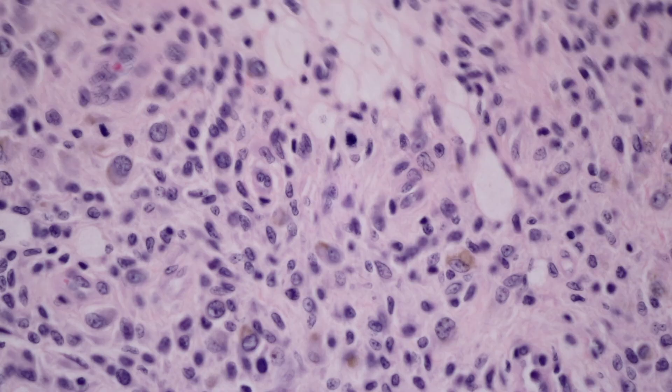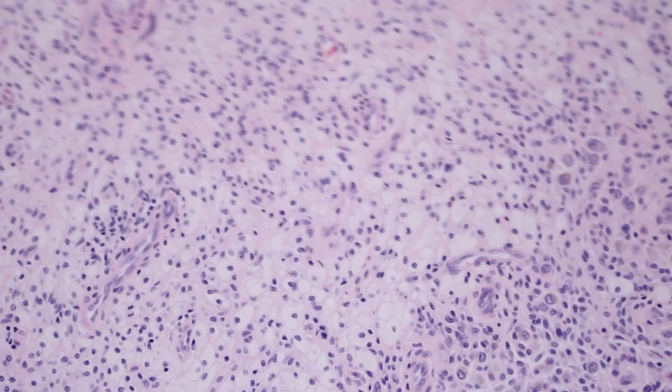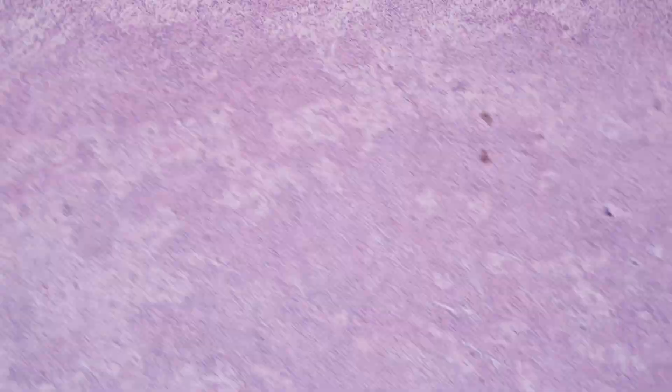In this field you can see mitotic activity — two mitoses just in one field. So the large cells — don't let that worry you. The mitoses — don't let that worry you. The giant cell tumor of tendon sheath form does recur occasionally, but when it recurs, it's local and non-destructive. The diffuse form — pigmented villonodular synovitis — is more problematic. Even though it is technically benign and non-metastasizing, it can be locally aggressive and cause a lot of pain and morbidity, limiting range of motion of the joint, and it has a high tendency for recurrence.